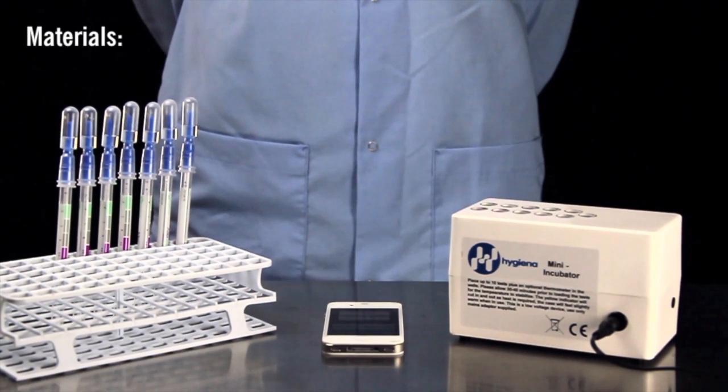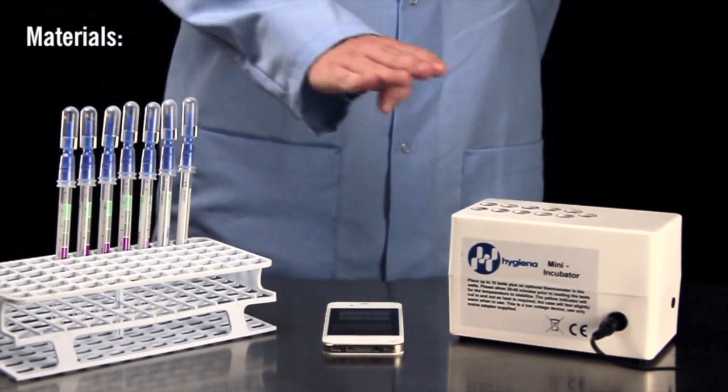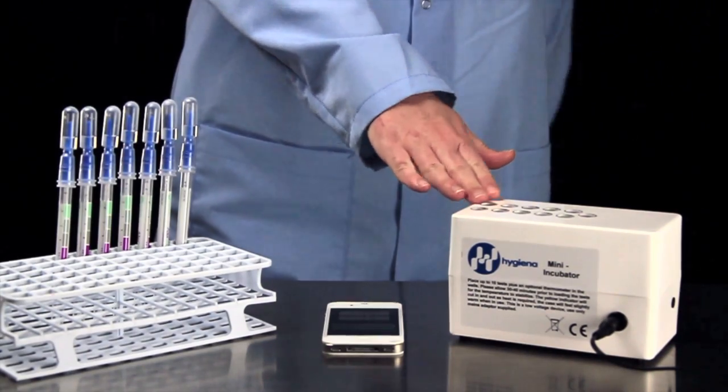The materials you will need include a Hygiena Allersnap test device, an incubator capable of 37 or 55 degrees Celsius, and a timer of your choice.